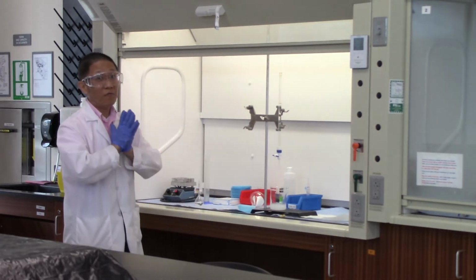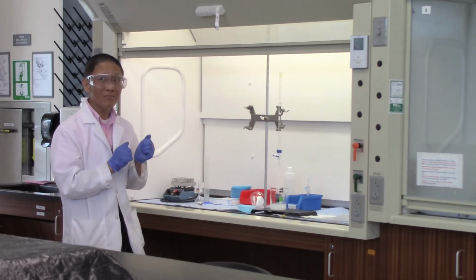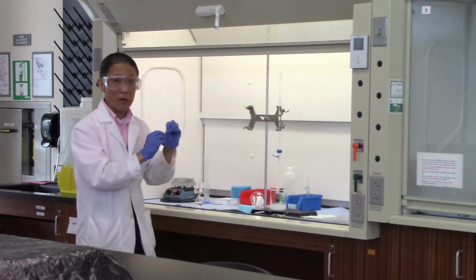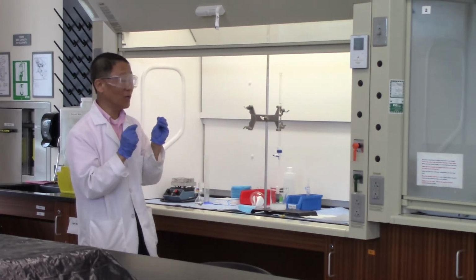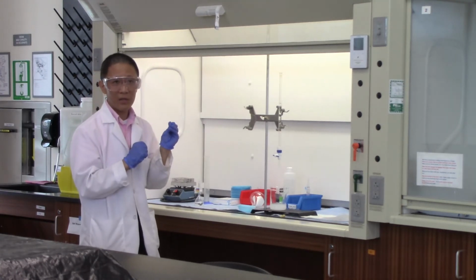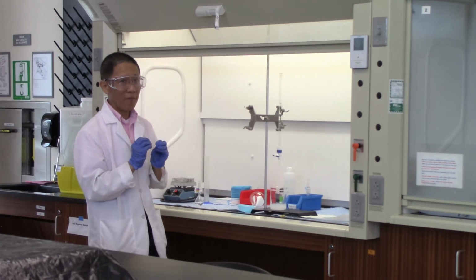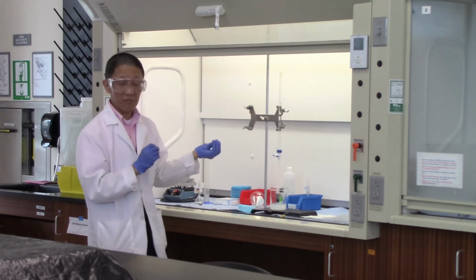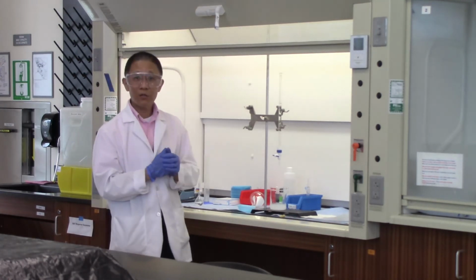We want to make sure that we have finished precipitating out all of the sulfate ion. How do we make sure that is done? Well, we can add a couple more drops of barium chloride into the clear top liquid. If you see more white solid start to come out, that means you still have sulfate ion in the clear solution, and you need to add more barium chloride. If you add barium chloride and you don't see any more white solid formation, then all of the sulfate ion is gone during the first addition of barium chloride, and you don't have to do anything. Let the solution cool down to room temperature, and then we're ready to do the filtration.